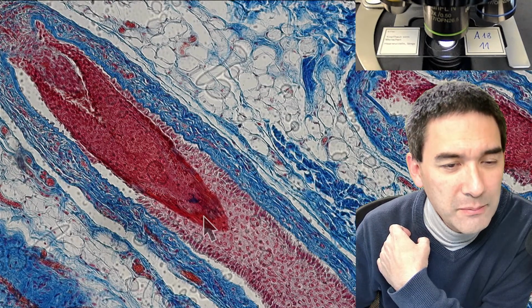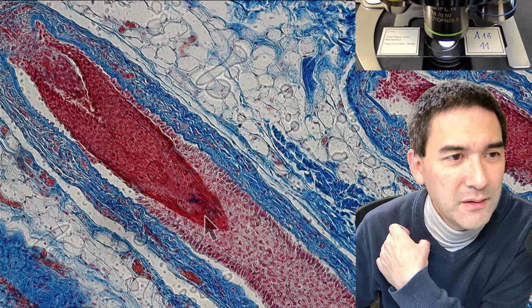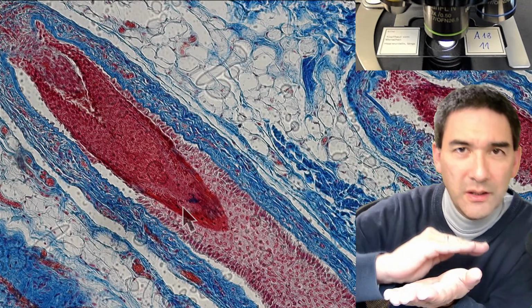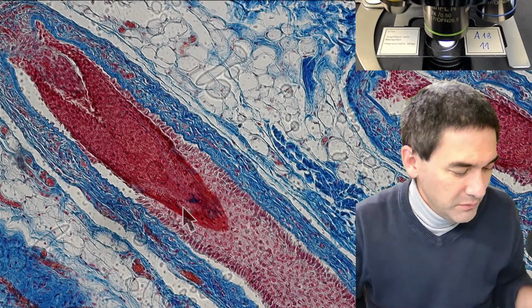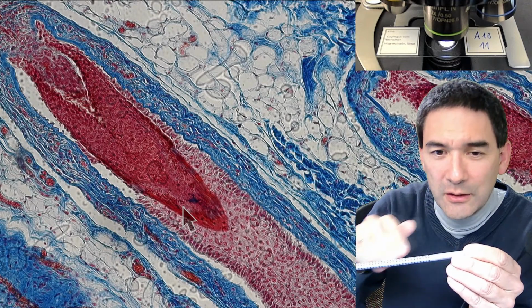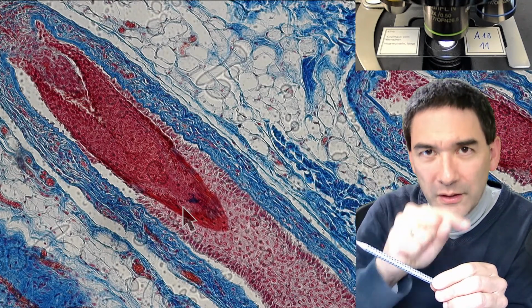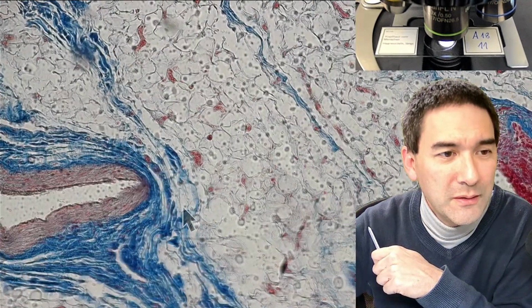and over here where it looks a little bit like fibers, I think this is actually where the hair is made. And it's that long because the hair follicle was not cut all the way, but it was cut diagonally. So if you essentially, let me use a pencil here as an example, if you cut the pencil diagonally across, then you're also going to see that it looks oval and elongated. And that's basically what we see here as well.